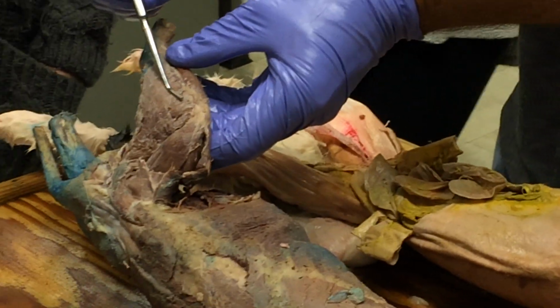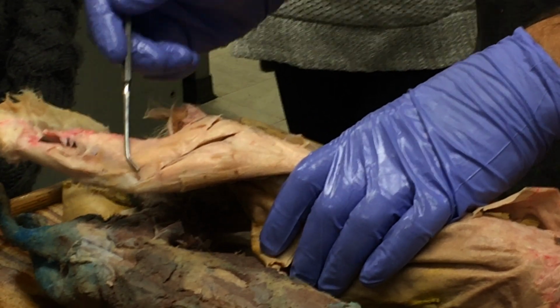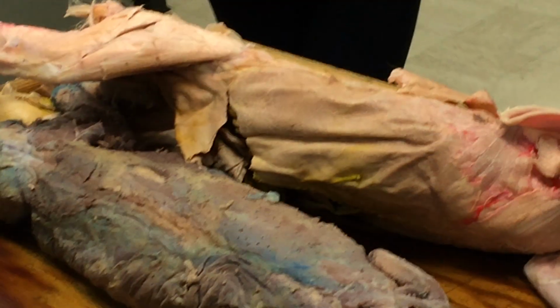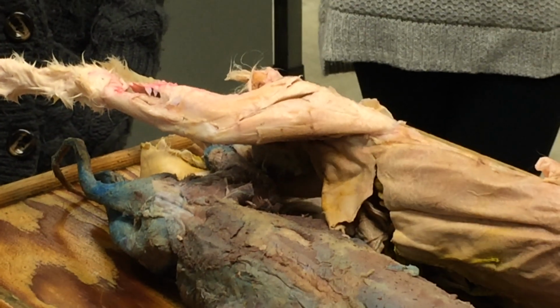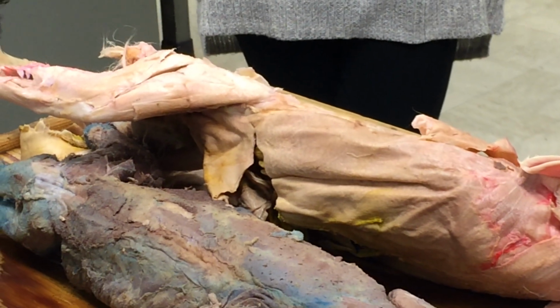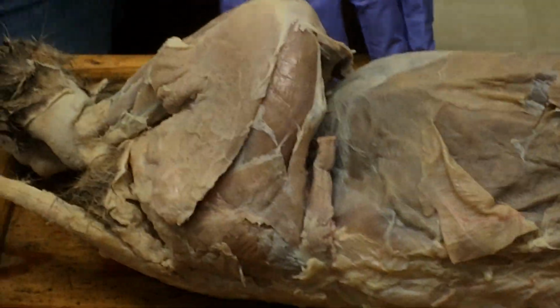Here's the same muscle in the mink. And here is the same muscle in the rabbit. Good? If you ever feel like, really, that's the same muscle? I don't, or if there's any question, don't hesitate to stop me, because otherwise I'm just going to keep going. It's a good quiz question. Biceps femoris, you like that one? Because it's big, it's obvious. It looks similar, doesn't it? Yes. Okay.